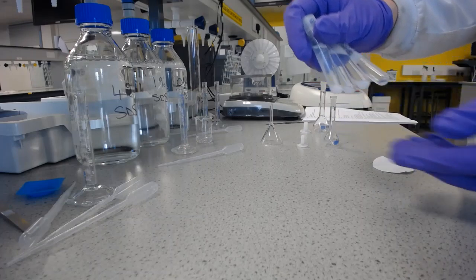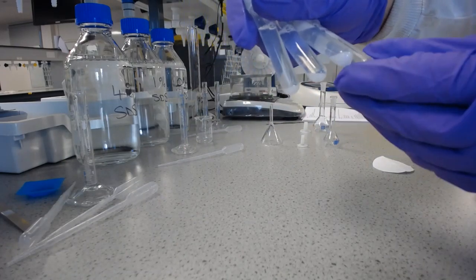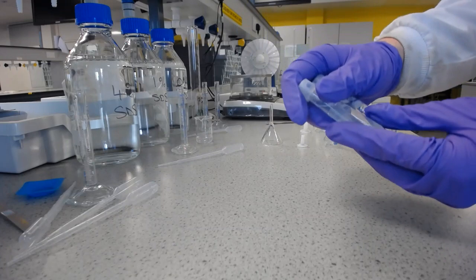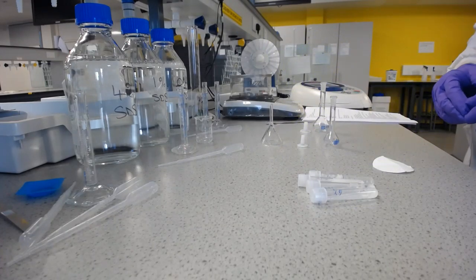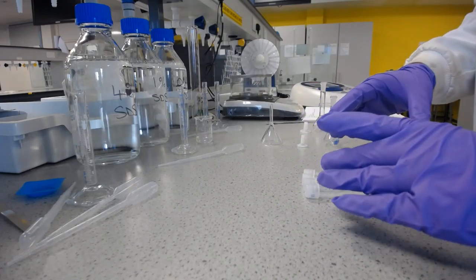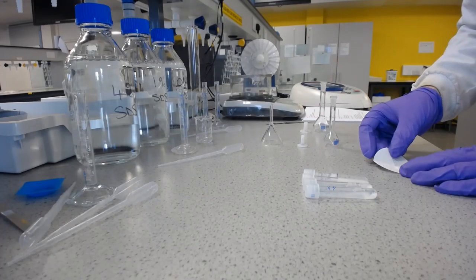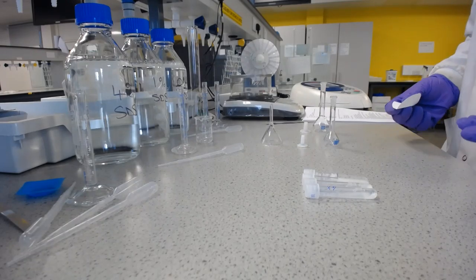Now you can see that we clearly still have got aspirin left in the bottom or at the top of all of these. So we're pretty sure that we've saturated the solution, although in some cases you may need to mix for longer than that, because whilst dissolution may be spontaneous, it isn't necessarily quick. And of course this is going to be the maximum solubility at room temperature.